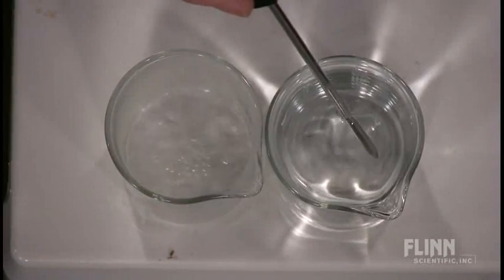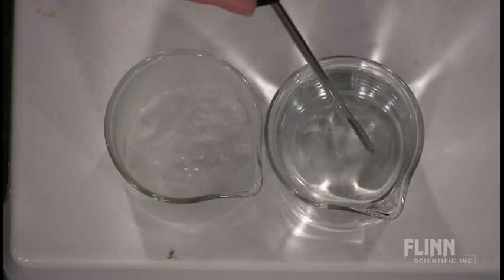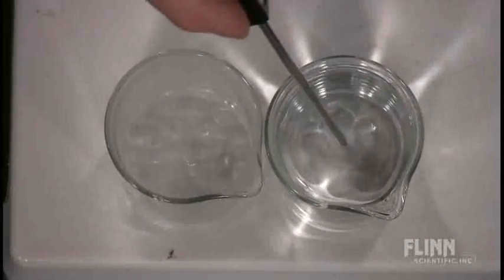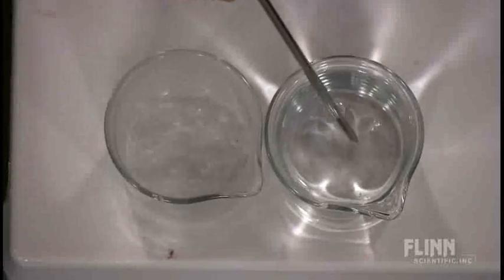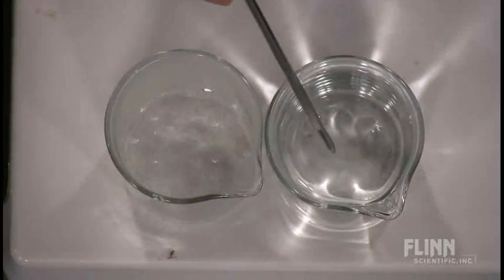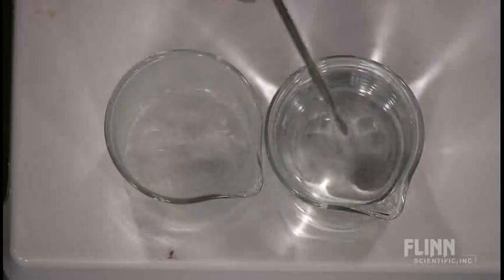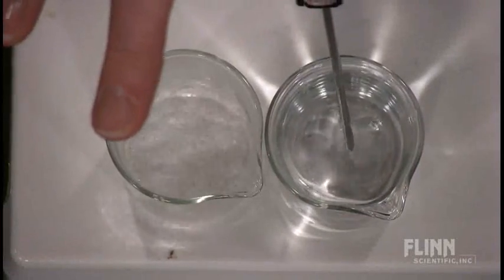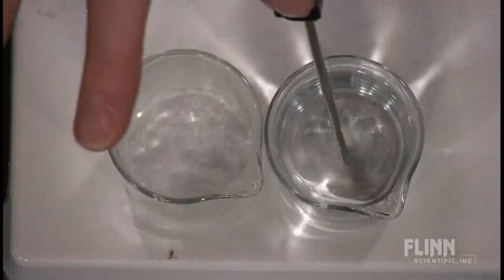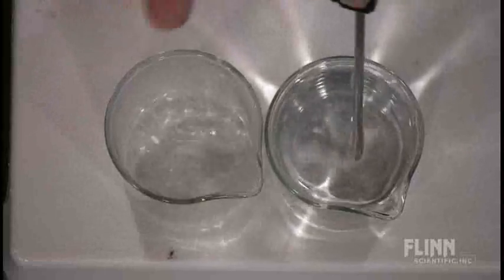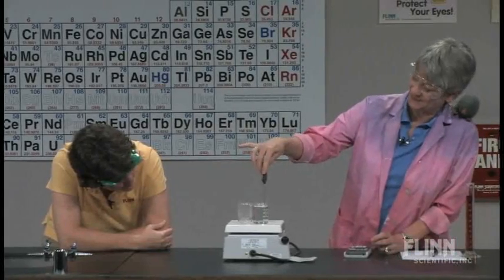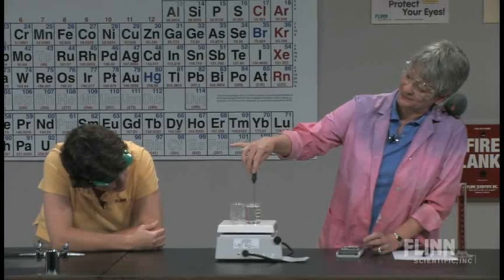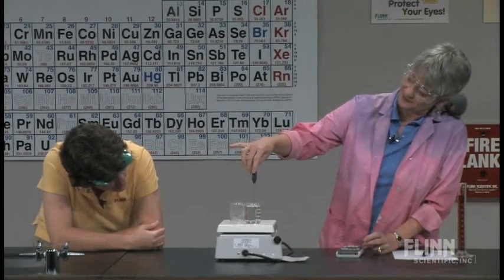And then I wait until all of the water is gone. Including the drops on the side of the beaker? That would be good, although you may not be able to do that. That would be difficult. This gets hot when you hold your hand over the hot plate. Let's stand off to the side a little.